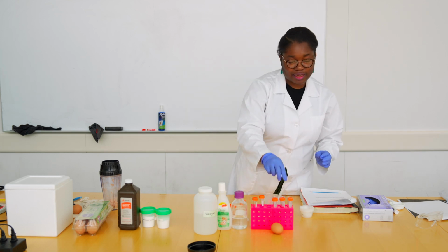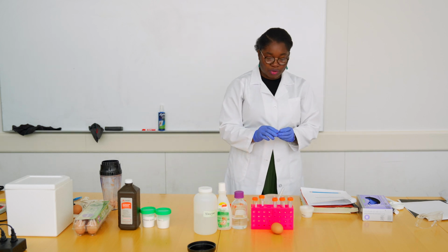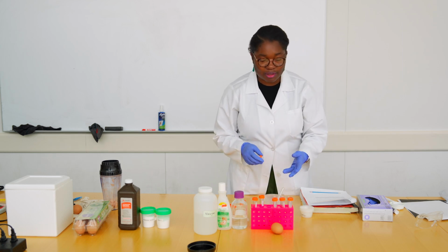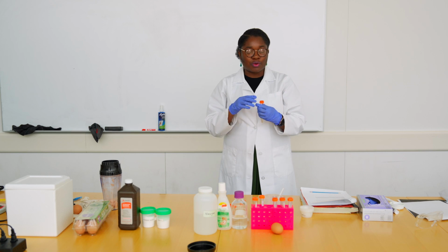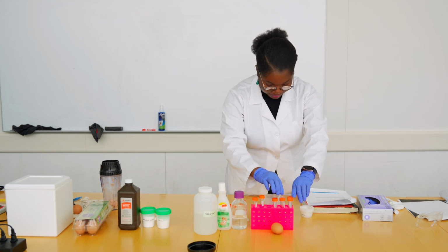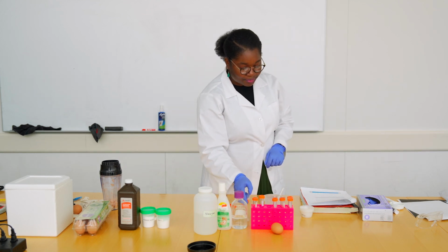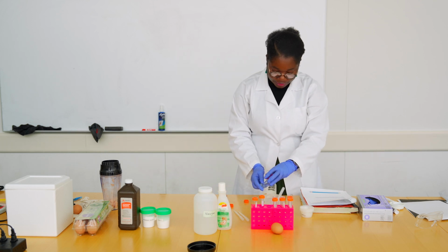And while you're doing all that, make sure you record the quantities in your notebook, because it is important to know what variable you're changing and what you're keeping the same. And in all those tubes, you can realize that the quantities of what I've added to the reaction are the same. In the control catalase, there's one more thing that we are going to be adding, and that is 10 drops of water.